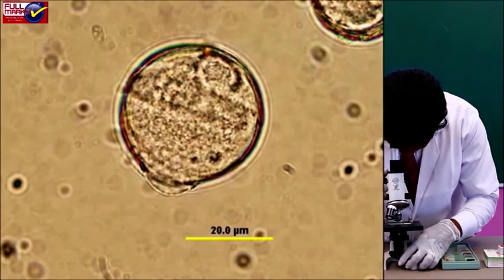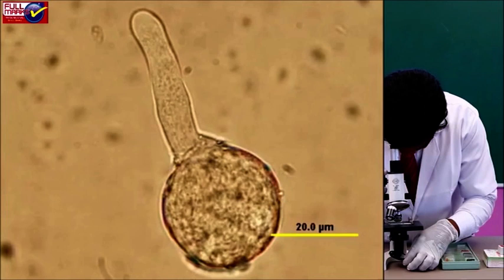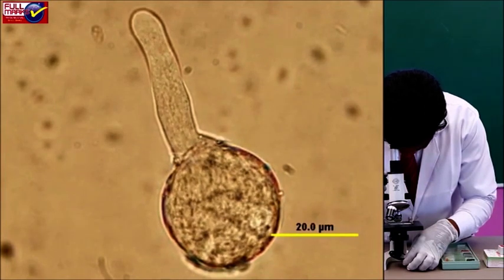Count the total number of pollen grains seen in the microscope field and the number of pollen grains that have germinated.